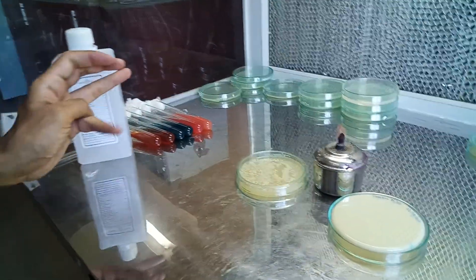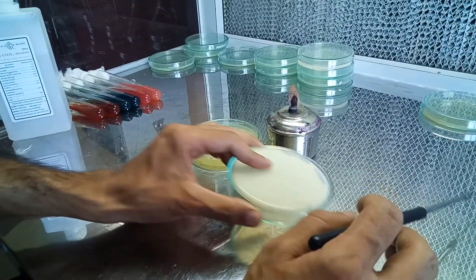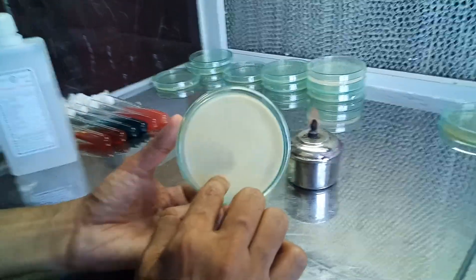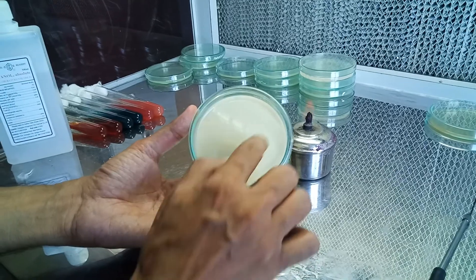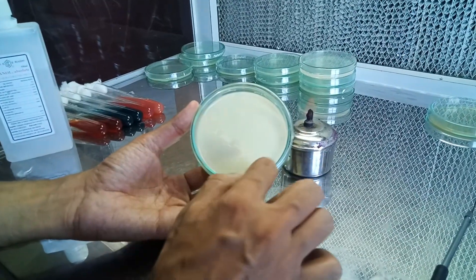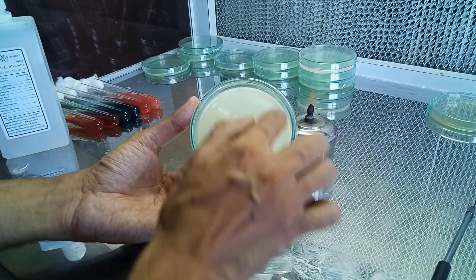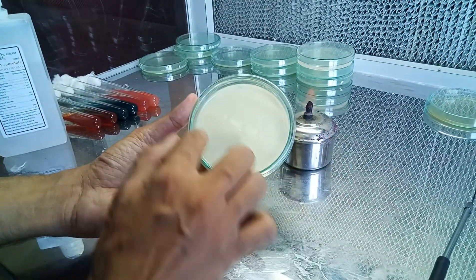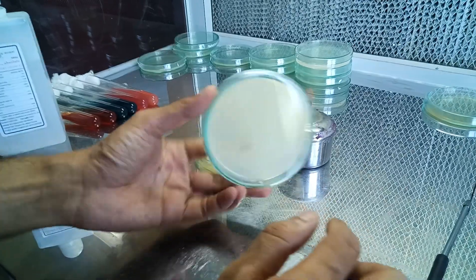We'll explain a bit about the casein hydrolysis test. This is casein agar — we can add milk to nutrient agar, and as you can see, it is an opaque medium. That is because of the colloidal suspension of the skim milk that is present, and casein is present all around here.